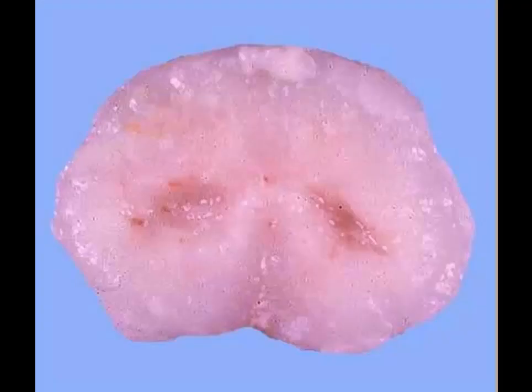Slide number 10 is tissue from a pig. I'd like a morphologic diagnosis and a cause. Okay, get a good look at this one. Classic lesion that has been seen in pigs. The morphologic diagnosis that I want is bilaterally symmetric. And whenever you use the term bilaterally symmetric, you're usually talking about a toxin or a nutritional problem. This is indeed a toxicity.